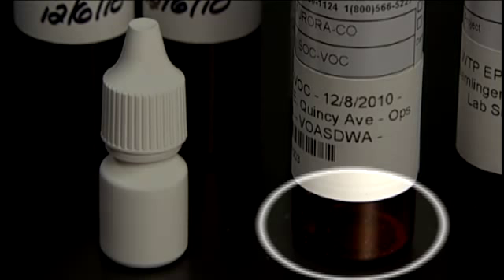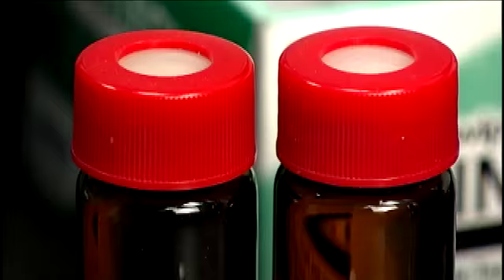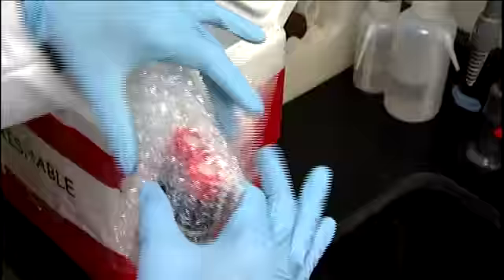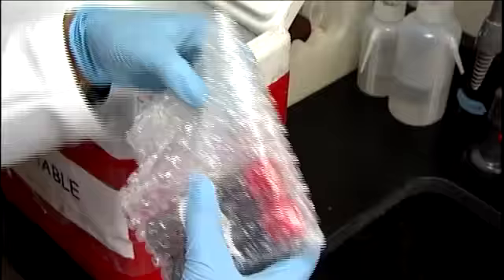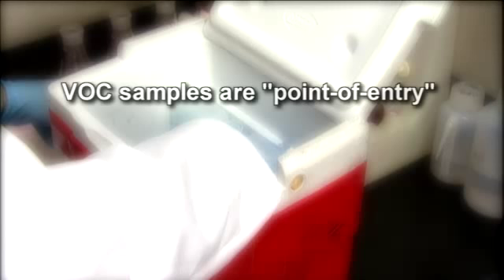VOC samples are often taken on a quarterly or annual basis and are typically analyzed by a contract laboratory. The lab should provide containers containing a dechlorinating agent, as well as a separate preservative, generally an acid. Acidification of the sample is done at the time of collection by the sampler. Trip blanks are samples filled with reagent water that serve as control specimens and accompany the actual samples through the entire trip from the lab to the sample site and back. Handle and package the trip blanks the same as the samples, but never open them.